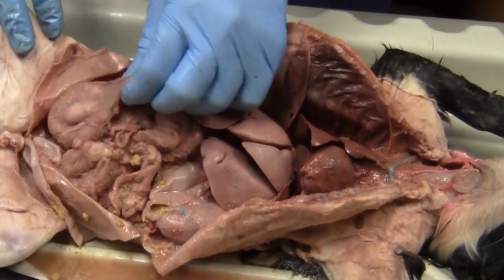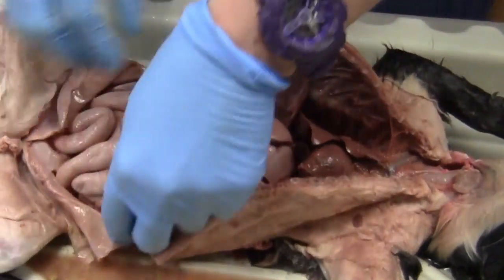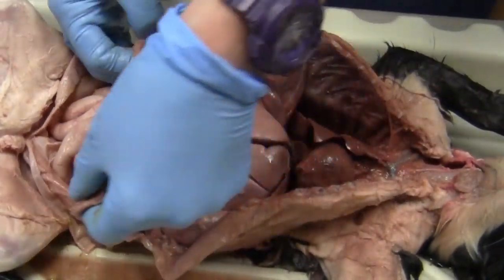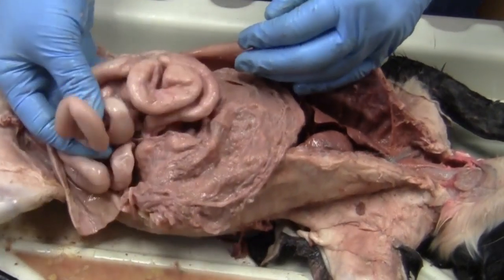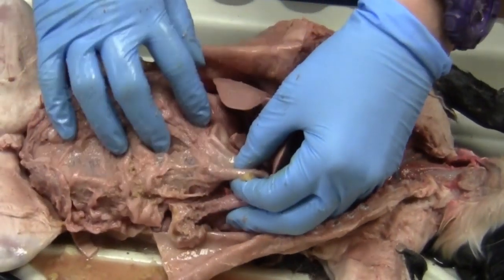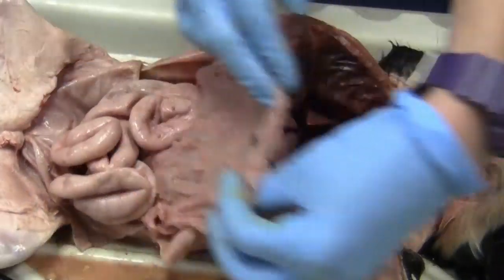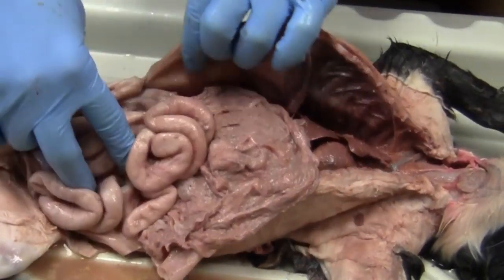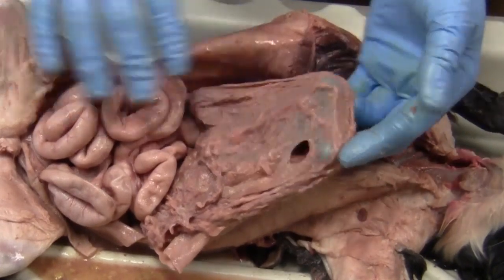And then we're going to move on to this good stuff that's actually covering the small intestines. You guys are probably like, what in the heck is that? So this is called the omentum. And you guys really want to try to keep this intact, so you can just lay it over when you go over it and start looking at the small intestines and large intestines. This omentum is only attached up here at the stomach, and it serves as a little bit of protection, and it goes around the small intestine. It can also act as a lymph system. So if something pokes through the small intestine, that can help a little bit with those sorts of situations.